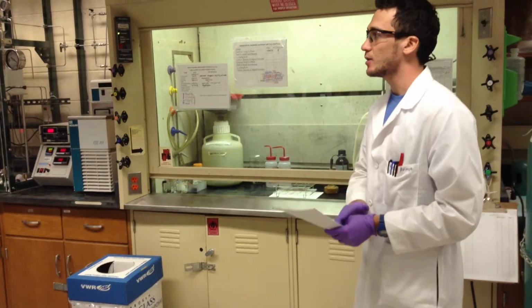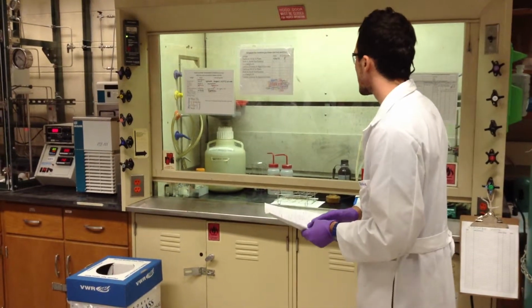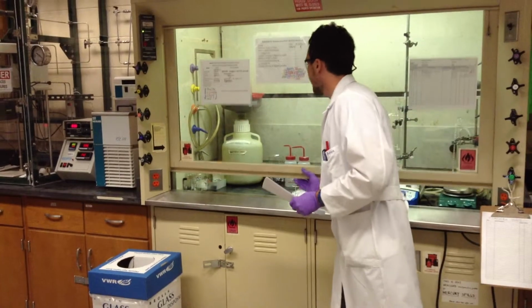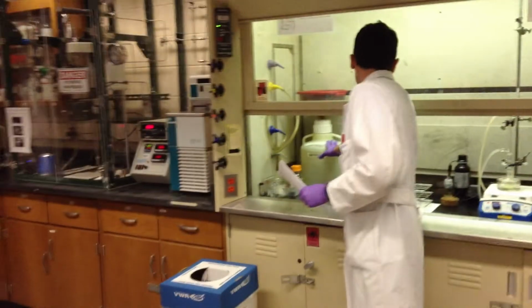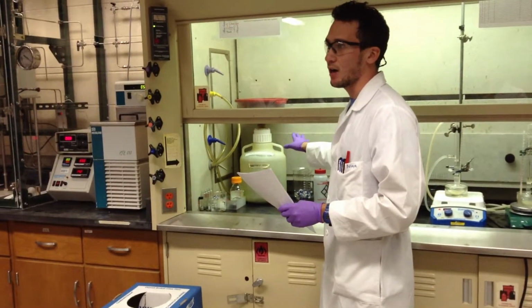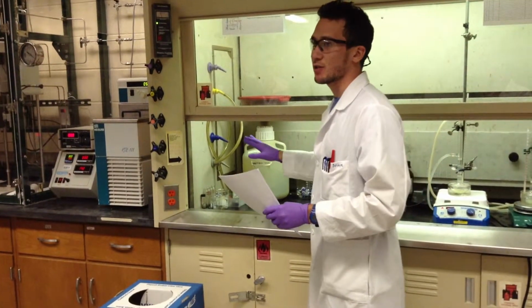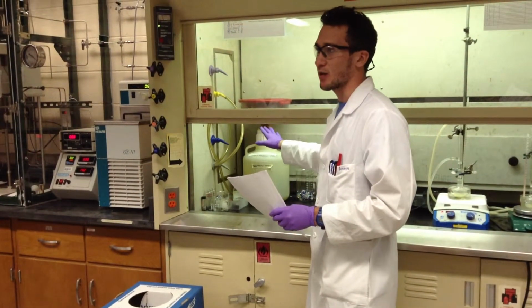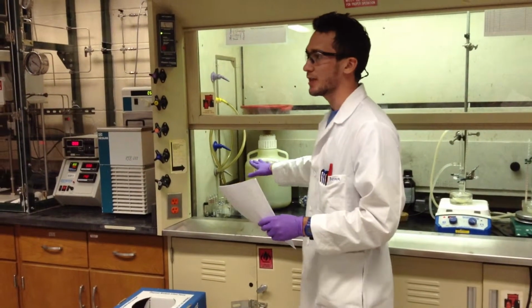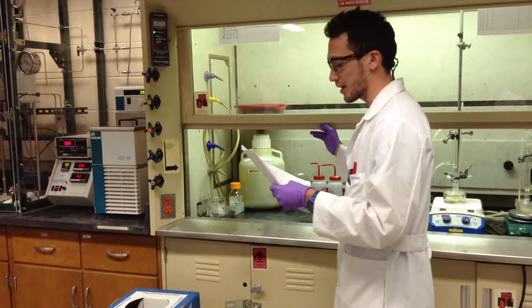in all the hoods, we should have some waste disposal containers. For example, in this lab, E105, we have a bottle for hydrocarbon waste. In some other labs, we also keep a bottle for inorganic acids or inorganic bases. But do not just assume that because it's a waste disposal bottle, you could just dump anything in it. You should read the label and make sure that you can dispose of the chemicals in it.